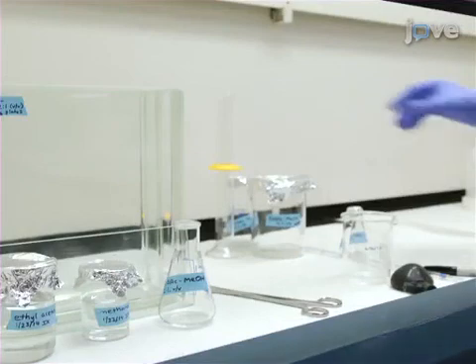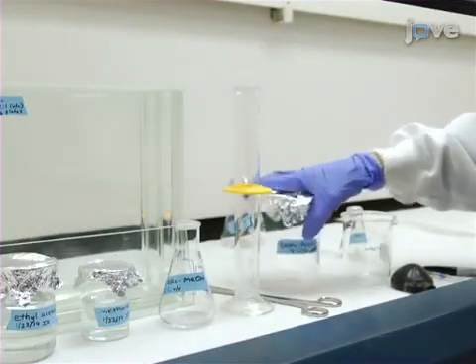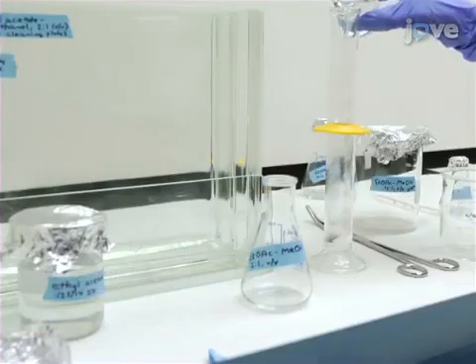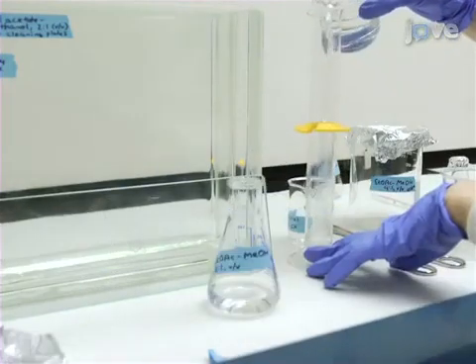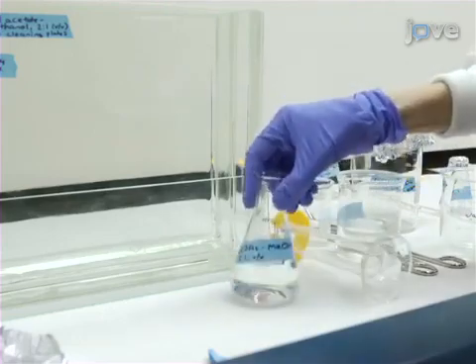Start by cleaning the thin layer chromatography or TLC plates. Working in a fume hood, prepare enough cleaning solvent to cover the bottom of the TLC developing chamber as well as the lower edge of a TLC plate when set inside the chamber. Here, ethyl acetate methanol 2 to 1 is prepared.